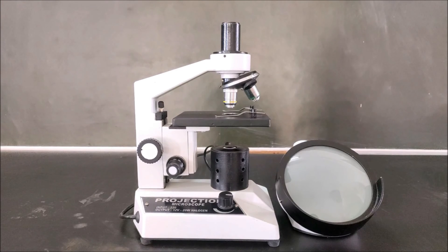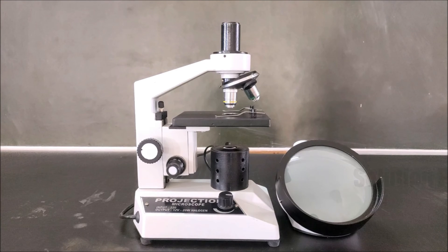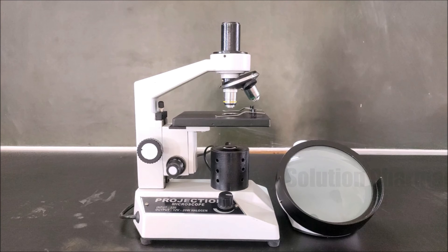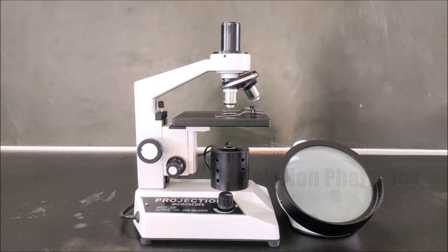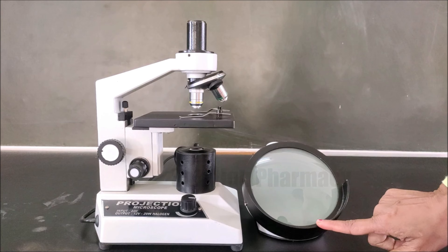Hello friends, welcome to the channel Solution. In this video we will tell you about the different parts of a projection microscope and also show you how to operate it.